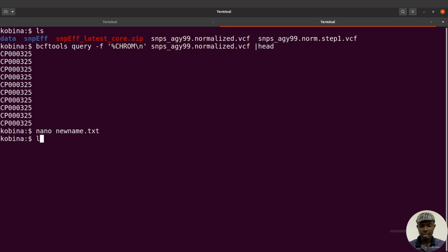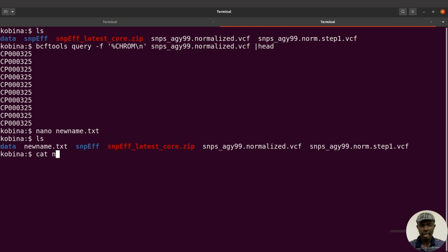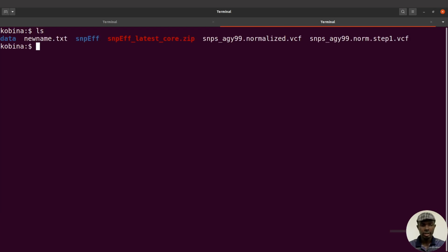If we save the changes, we can do an ls to take a look at the text file. You can do a cat to display it. That is fine. And now we are going to call BCF tools and do the renaming. That's what we are going to do next. Let's do an ls again and then proceed. We are going to rename the chromosomes in this VCF file. The information is available here, that's newname.txt. Let me just do a cat to see it again. Currently this is what we have in the VCF file, so we are going to change all the occurrences of this to this one here.